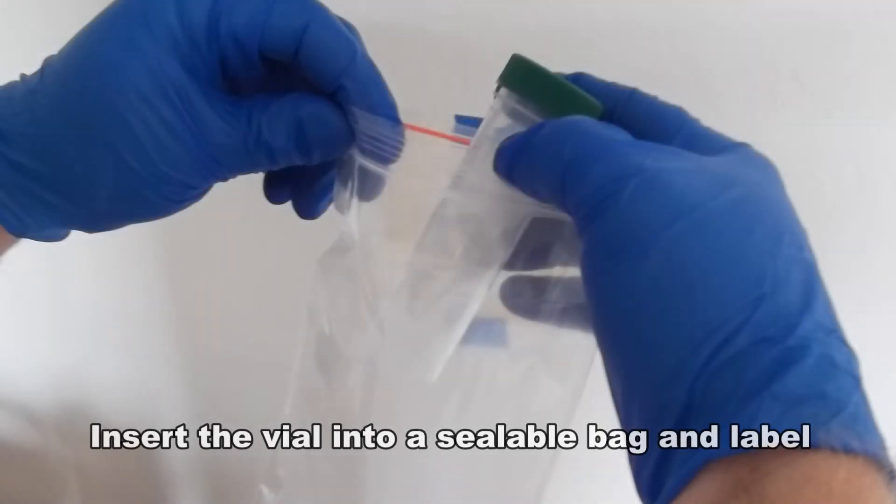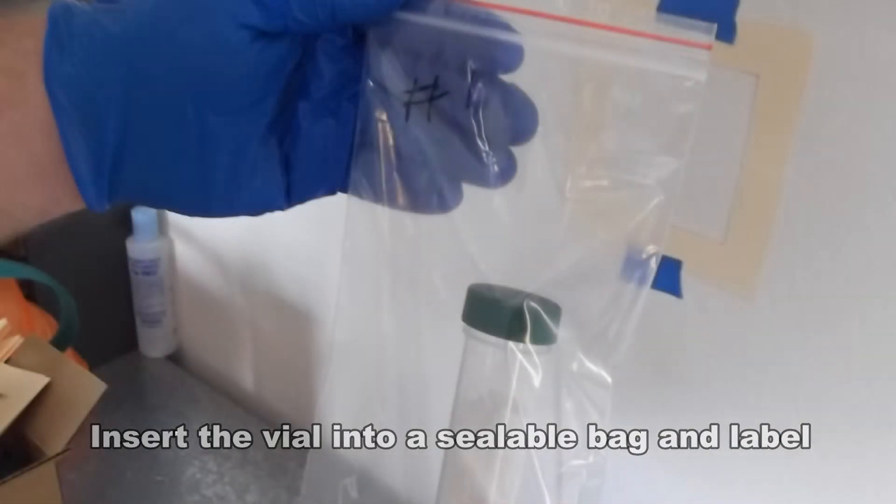Be sure to change gloves between each sample taken and a field blank should be taken for every 10 samples.